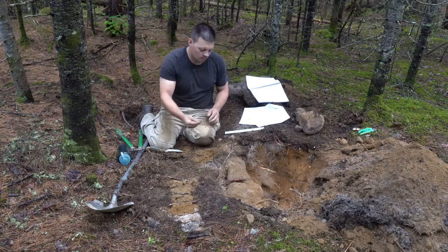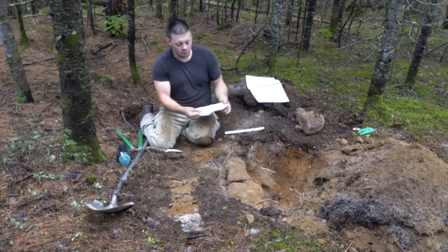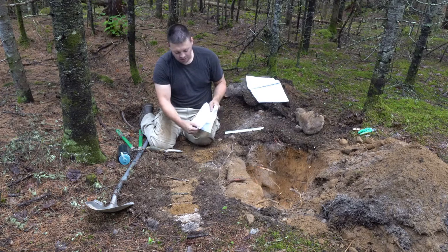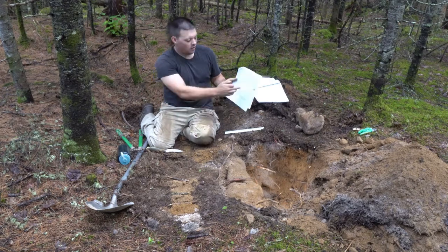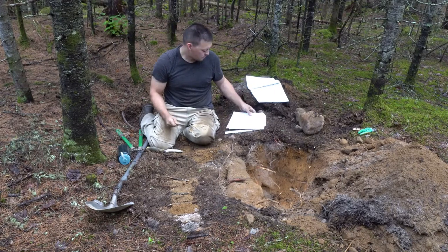Our last property that we look at is the color, and simply what we do is we take some soil in our thumb and our finger and we rub it on to create what's known as a color smear. That way we can identify the color of the soil based on our smear.